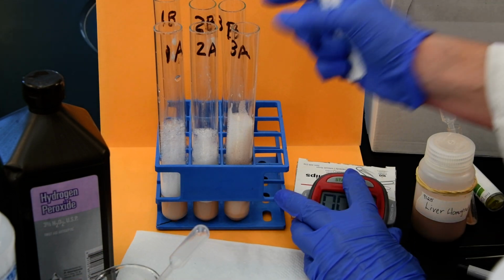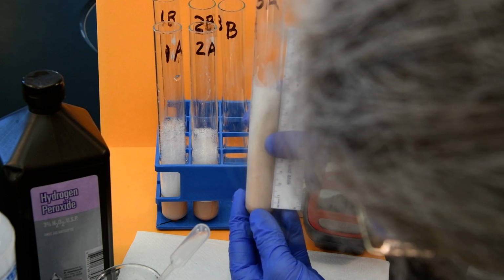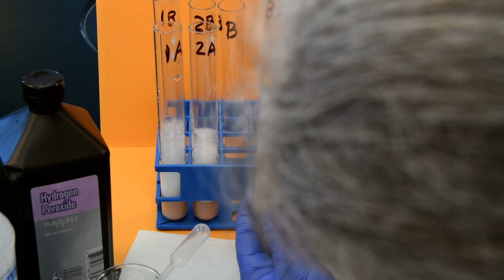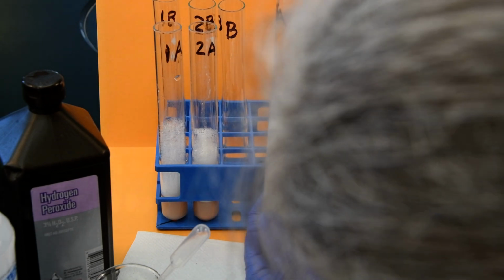All right. Okay, so in test tube 3A here, which had the most, we did get up to about, let me just be fair here, about 9.4 or 9.5.